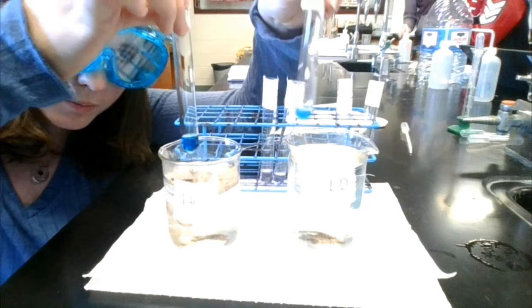So using the chilled or heated water baths here, it reveals something about the reaction. If you take a look at the heated bath, you can see that it's a much richer blue color and much clearer, versus on the right in the cooled bath, you can see it's still blue, but it's such a lighter blue and it's not as strong. So this reveals that this reaction is endothermic in the formation of cobalt tetrachloride.